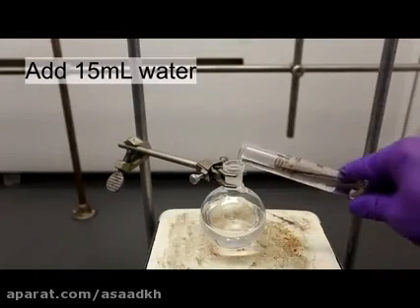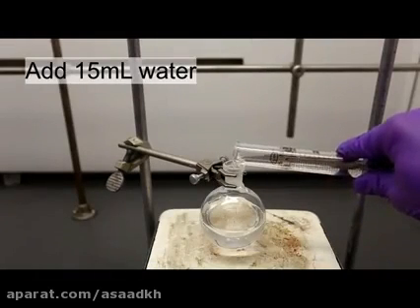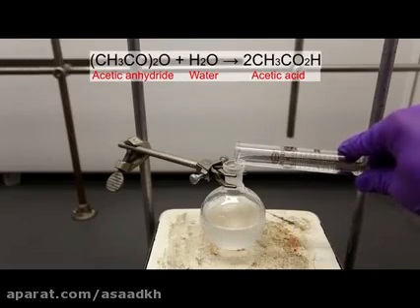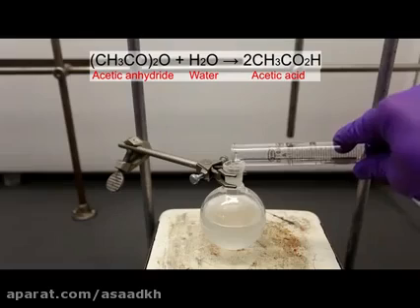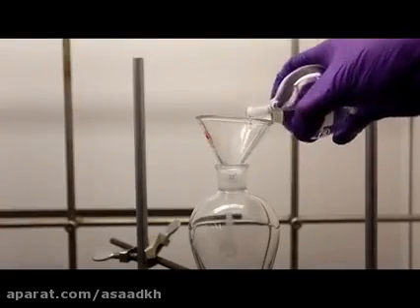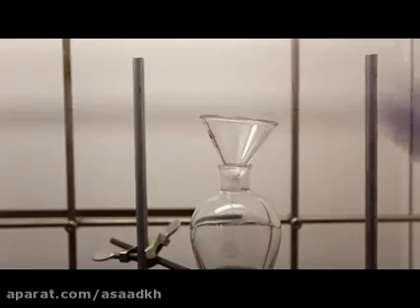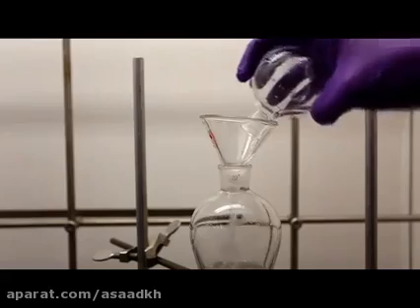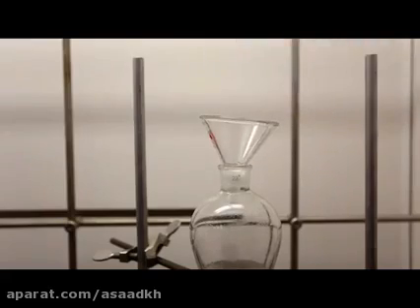15 milliliters of cold water was added to neutralize any remaining acetic anhydride. As shown above, water reacts with acetic anhydride to form 2 molecules of acetic acid. The solution was then transferred to a separatory funnel. The round bottom flask was washed with about 15 milliliters of water, which was added to the separatory funnel.